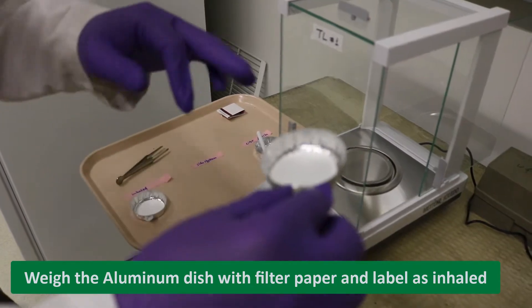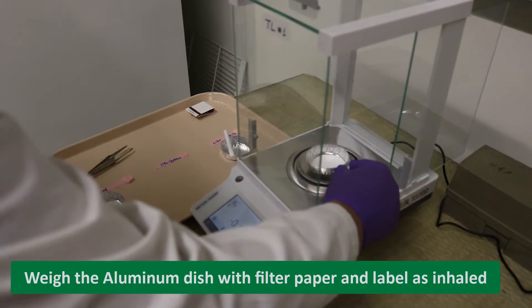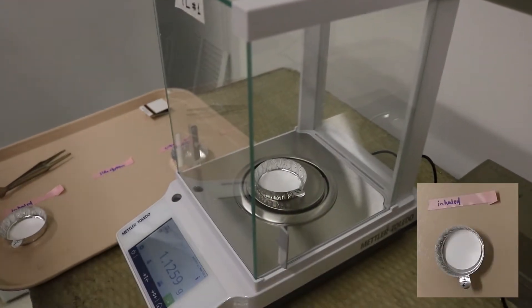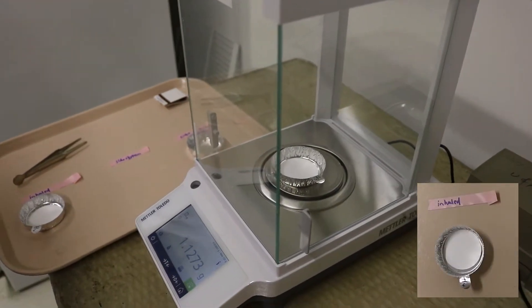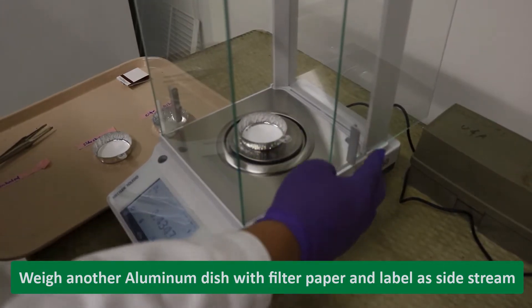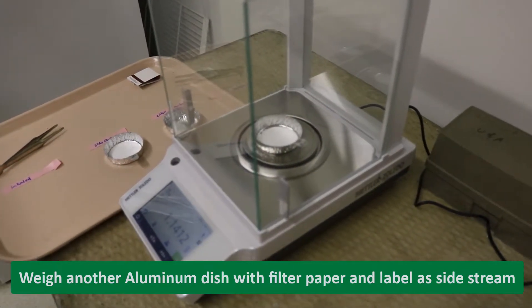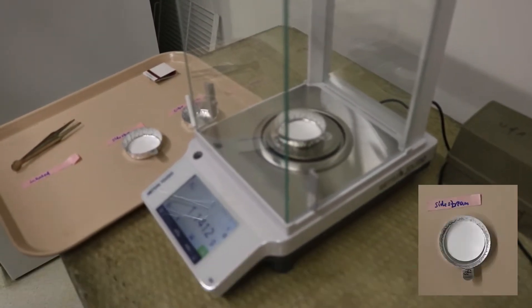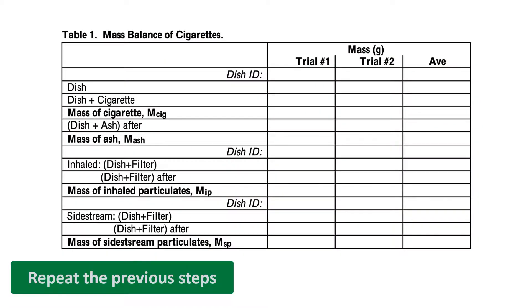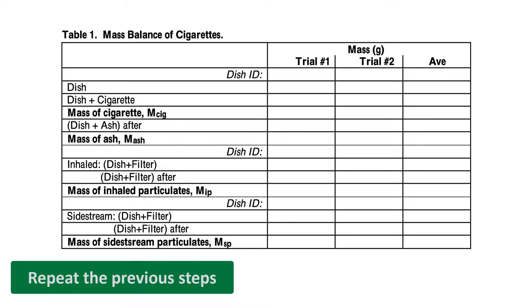Next, put a piece of filter paper in a second dish and measure its weight — label it as inhaled. Put another filter paper in another dish and measure its weight as well; label it side stream. Repeat the previous steps since we will do duplicate data.